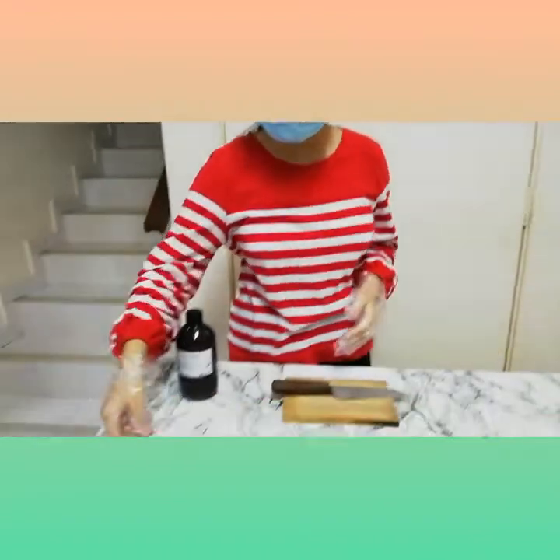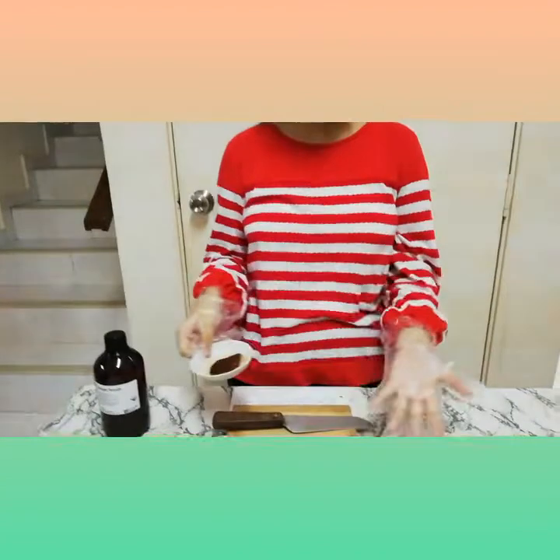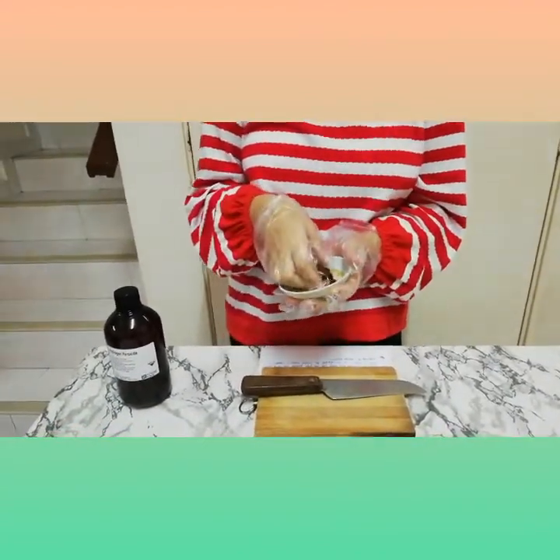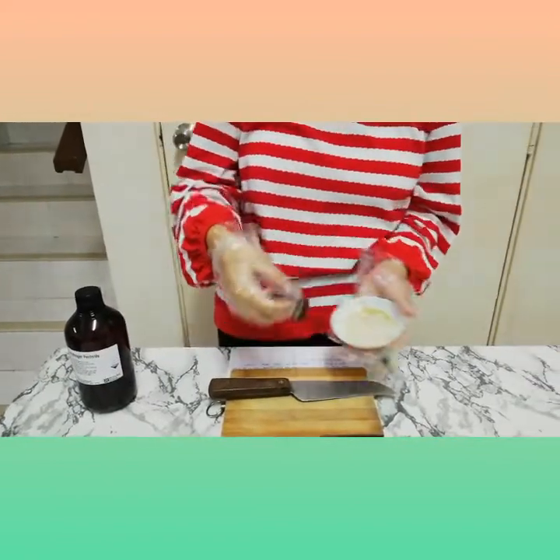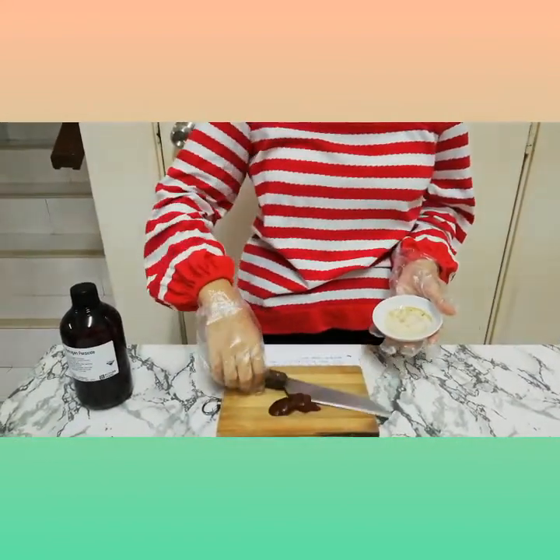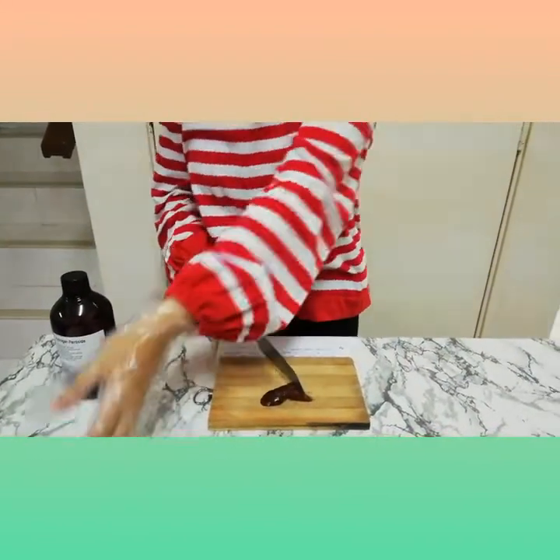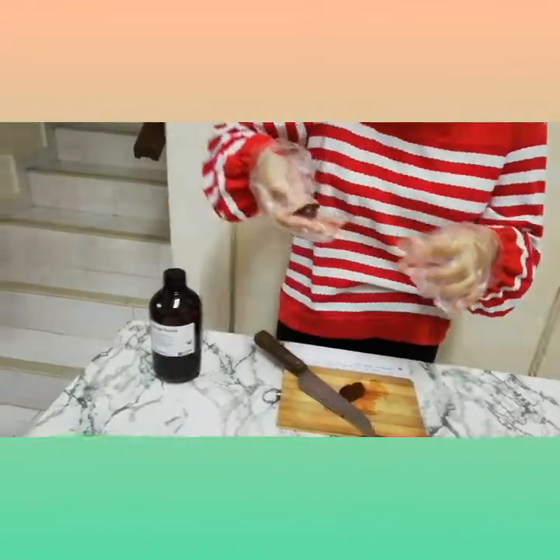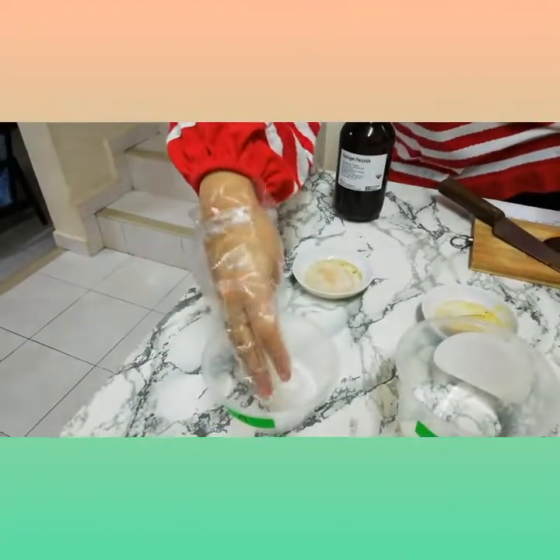Let's get started. Alright, so first I'm going to take all the food over here and I'm going to cut them into half. Now the reason why I am doing this is because we don't want to waste the material, so that's why I'm gonna cut all of the food into half. I'm going to place the food into their respective containers. First, we'll start with the raw chicken liver. The other half we're just gonna put it back here.